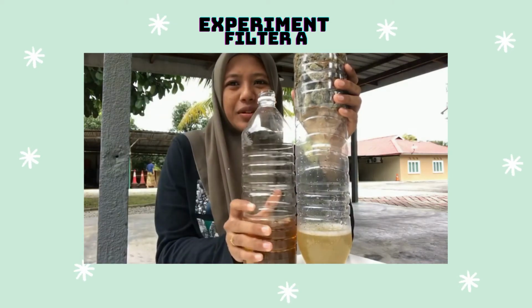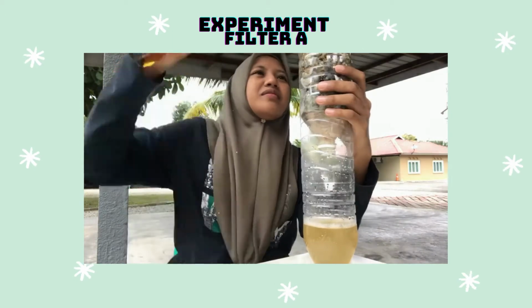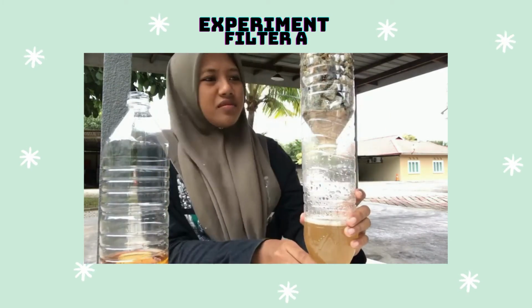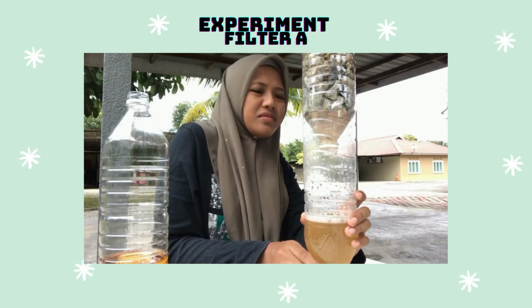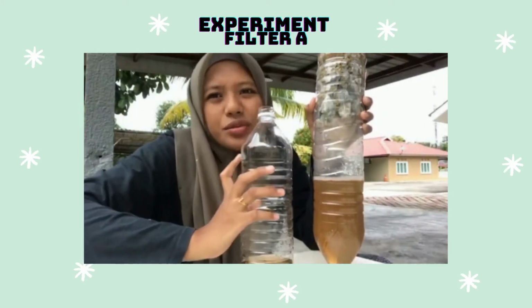You see, I will compare the colors. Okay, this is the current situation.